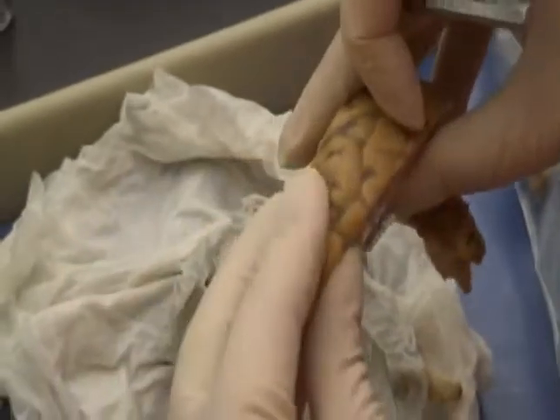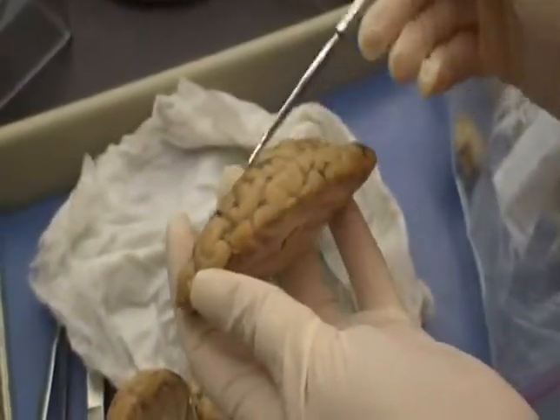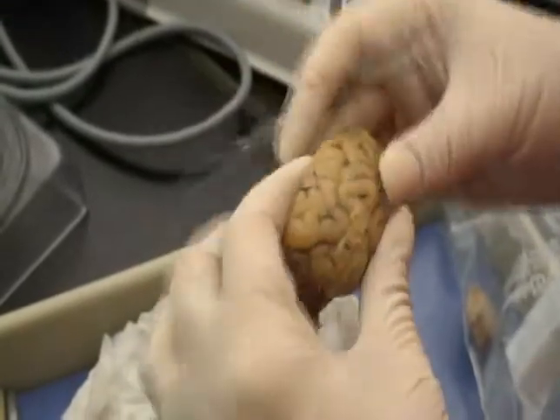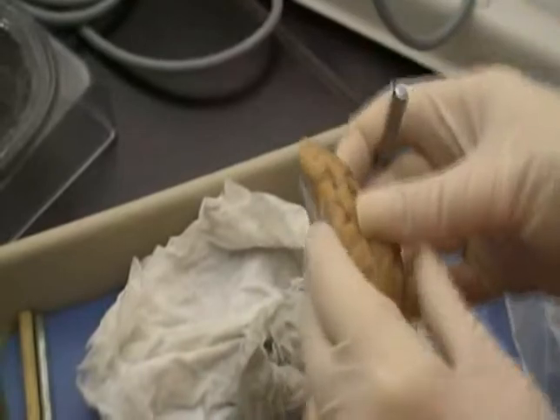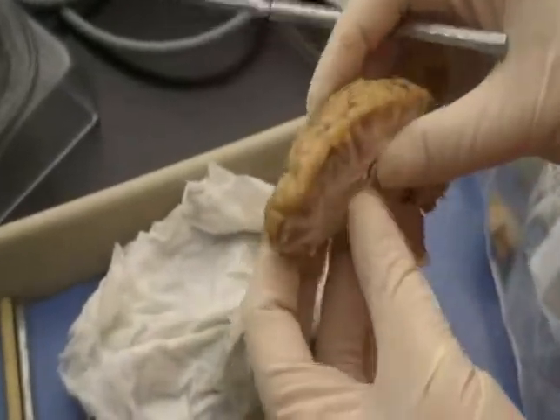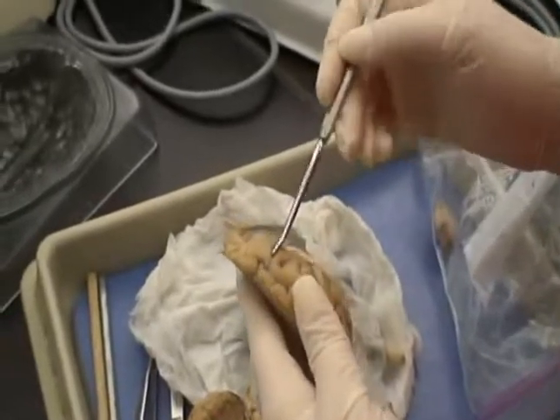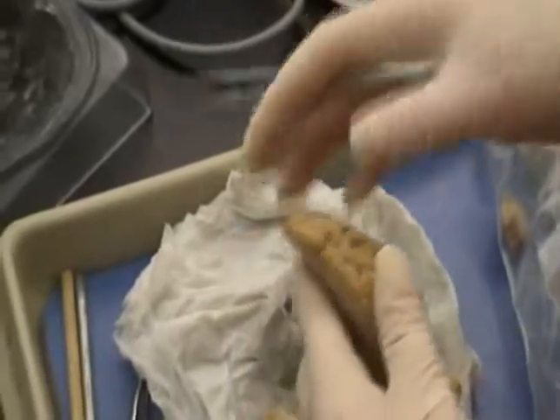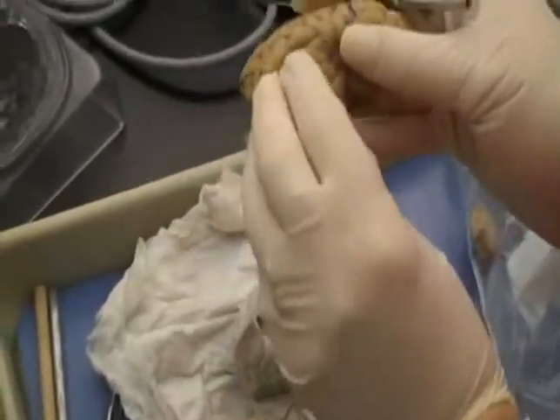Frontal lobe in the front here. Parietal lobe is this right here. Temporal lobe is to the side. Occipital lobe is in the back. Visual. Okay. The central sulcus, which is kind of hard to see on the sheep brains, but I'm going to say it's right about here. It's the division between the frontal lobe and the parietal lobe in the back. Okay. The primary auditory center is in the temporal lobe.